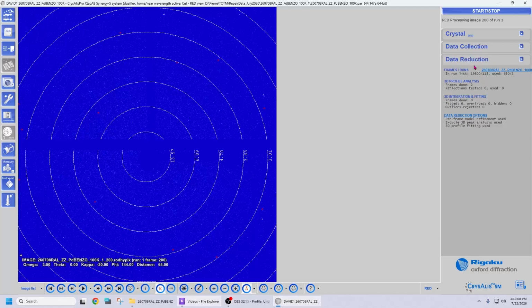For that, expand the data reduction tab and look at the top right corner of that tab. There's a blue link here that shows the name of the experiment. On the left-hand side of it, there's another blue link that says frames runs that is currently disabled. To enable it, go back to the first link, the one that shows the name of the experiment, and click on it. Then the frames runs option becomes available. Click on it and select repair dataset. And that should be all you need to do to repair a dataset that contains a few corrupted images.